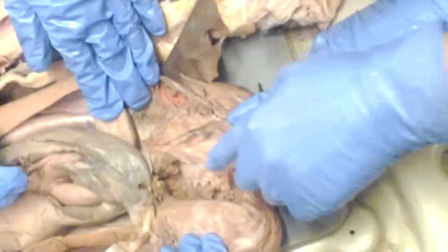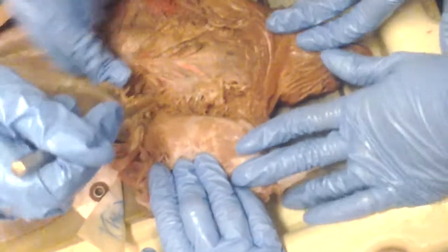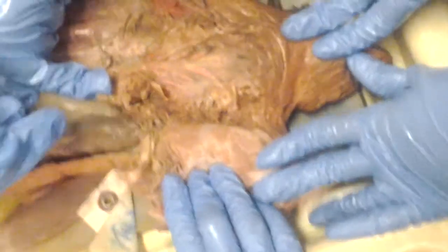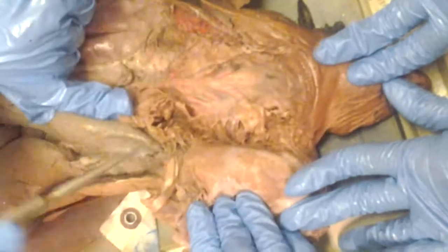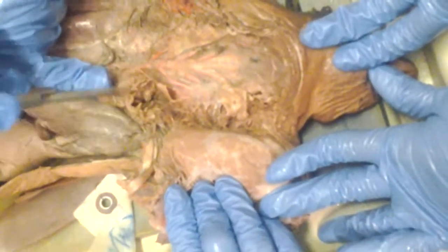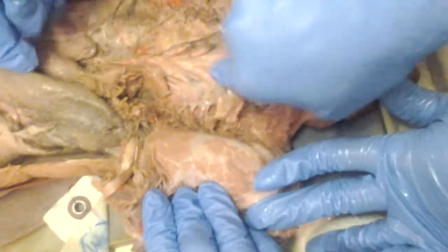There's the papillae. That's the esophagus papillae. Yes, esophageal papillae. They are these little finger-like things. You can see them. See here, this is the esophagus. These are the esophageal papillae, little finger-like things. Okay. Blood vessels. You can do the circulatory flow, this is great.